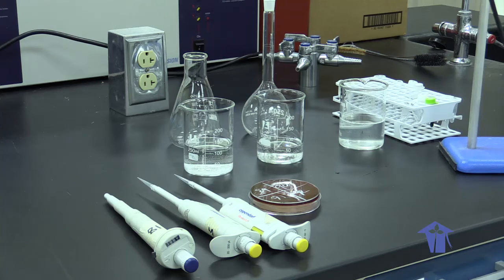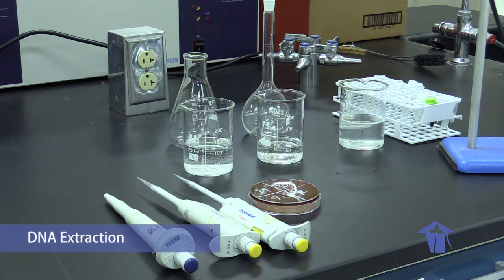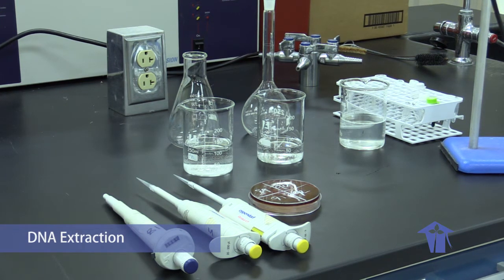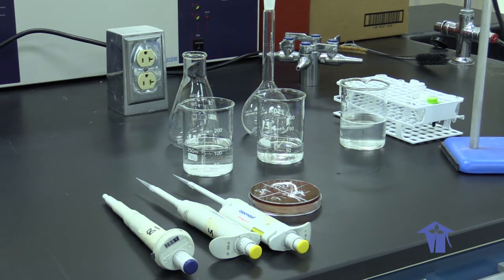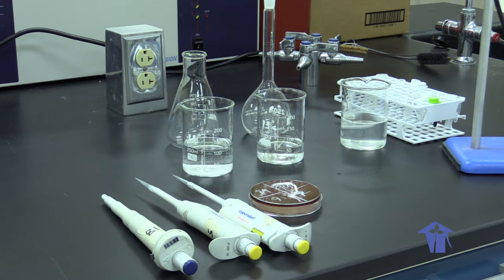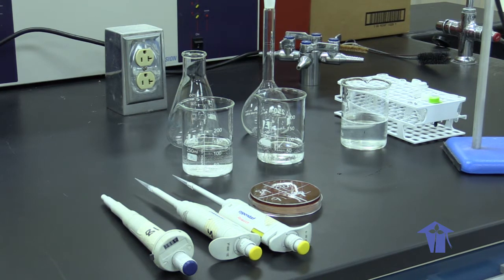Hello everyone. Today we are going to be doing the extraction and the processing of DNA by PCR from microorganisms. This is for the MDLT 499 course, and I am your instructor, Renan Thompson.